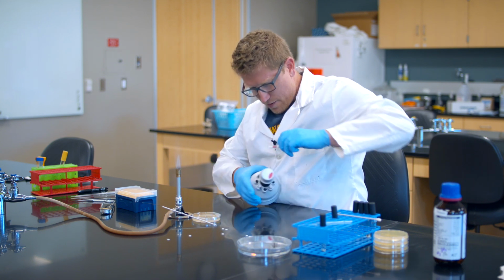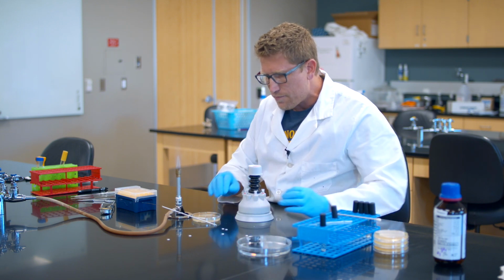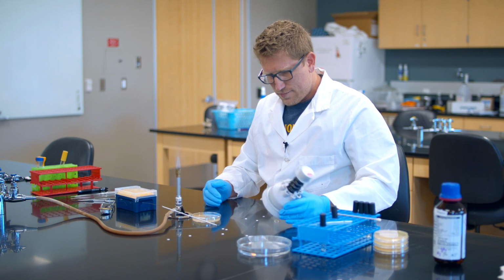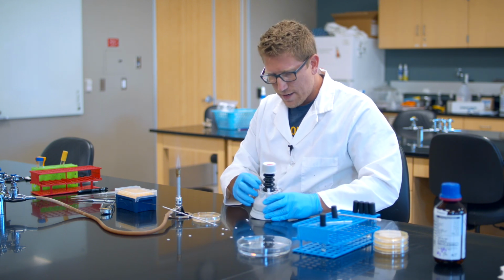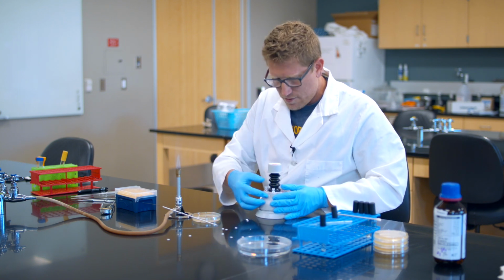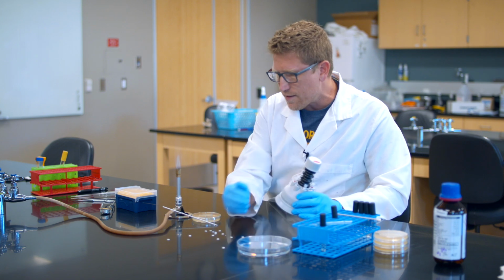Come on. There we go. I'm going to put it in a different chamber and see if it fits a little better. There we go. Okay. Still only 3. Still only 3. It doesn't like one of these. Which one doesn't it like? All 4. There we go. Okay, so they're all coming out.